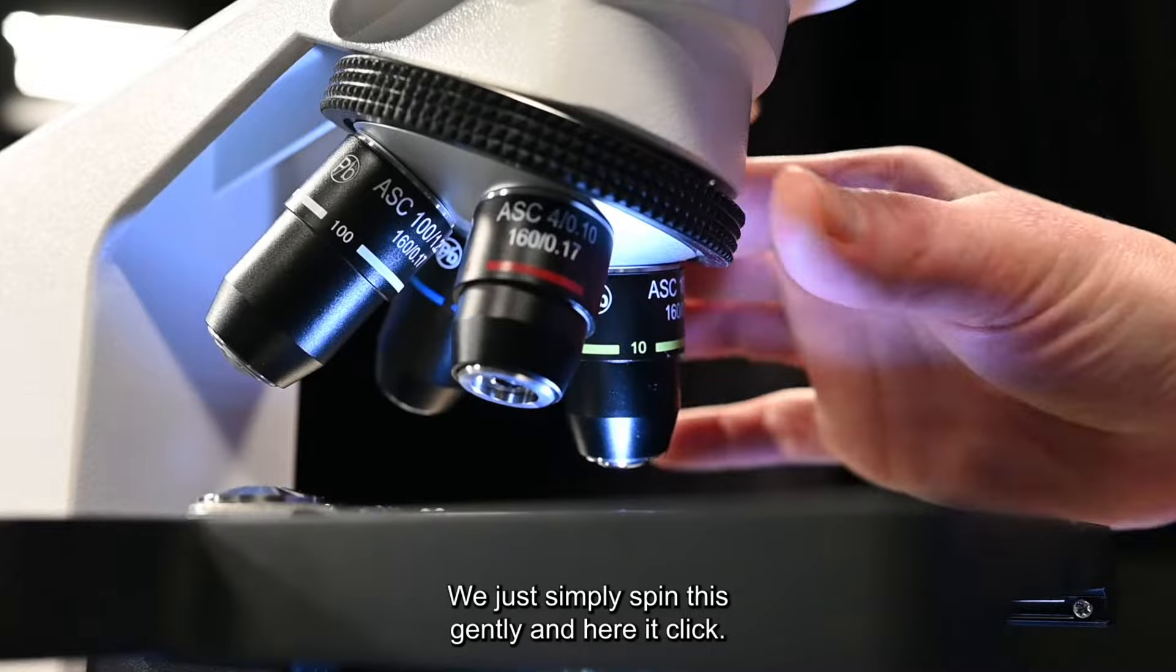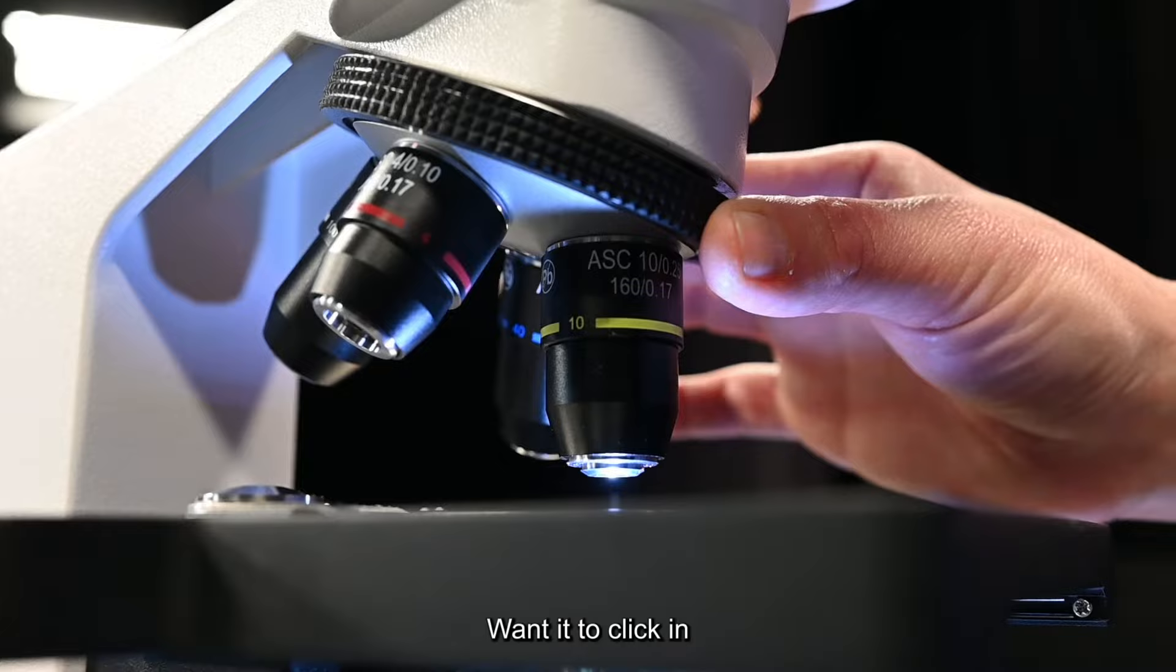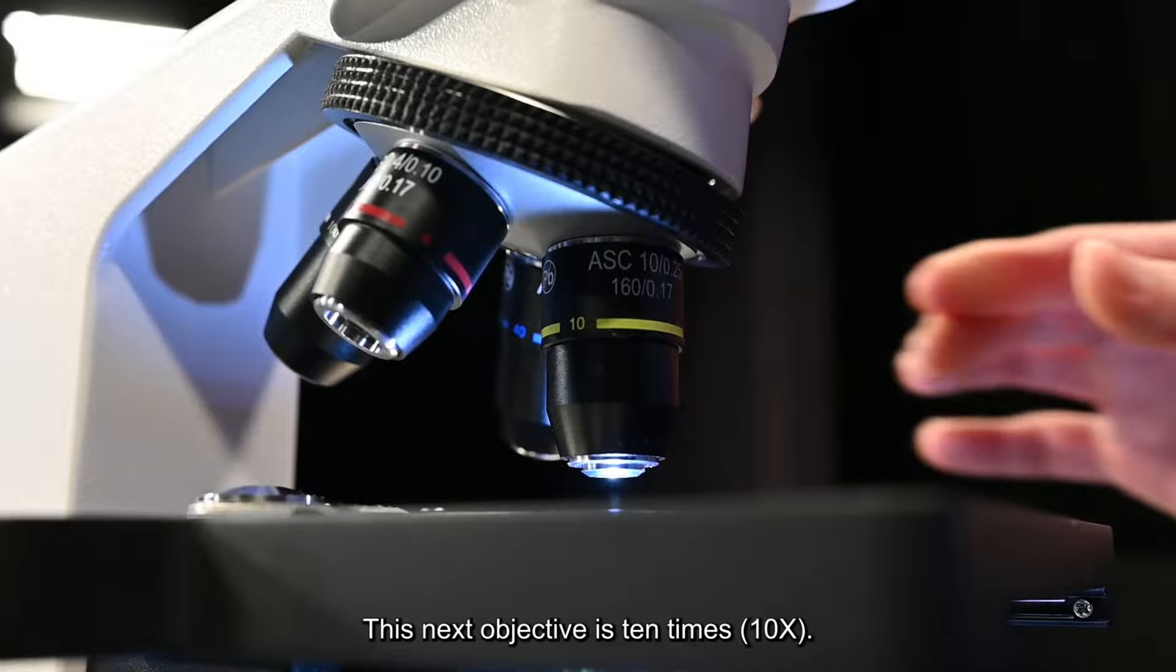In order to go to the next magnification we just simply spin this gently and hear it click. You want it to click in place and if it doesn't click in place you're not going to get good focus.